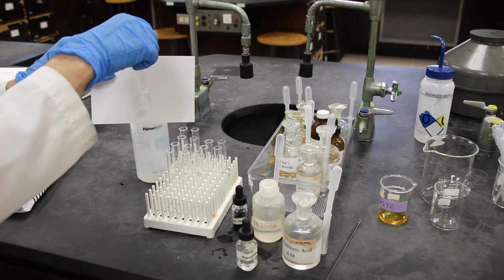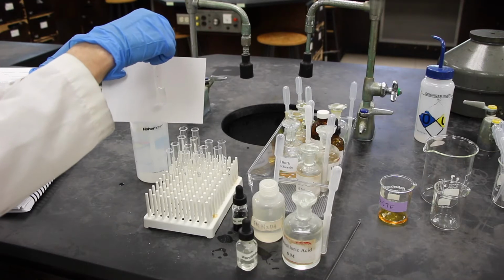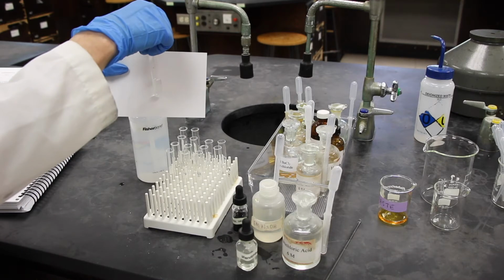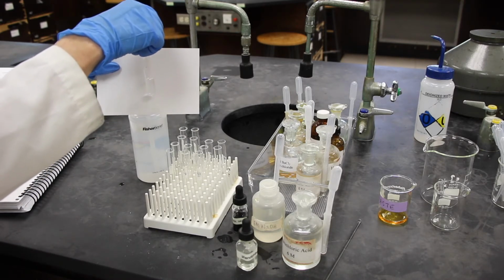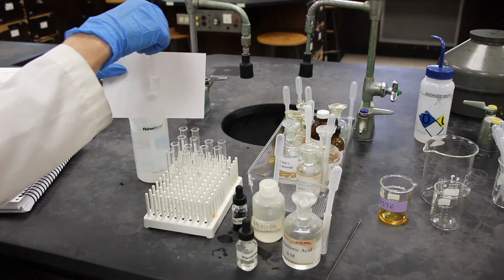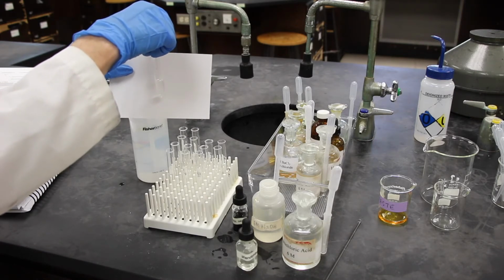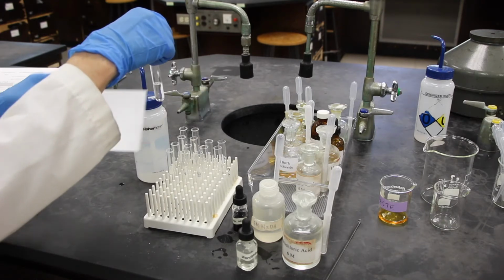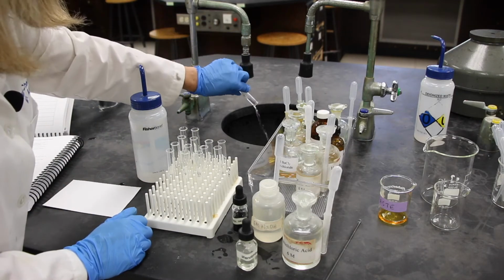And you can complete the rest of data sheet B. Again, we added hydrochloric acid, H plus ion and Cl minus ion. Do you see either one of those in the balanced net ionic reaction? And if you do not, could they react with one of the constituents in the balanced net ionic reaction? And this also can be disposed down the drain, and I'll do that now.